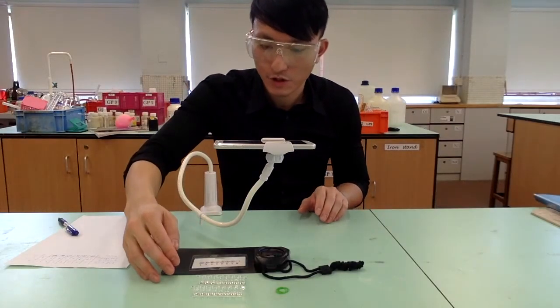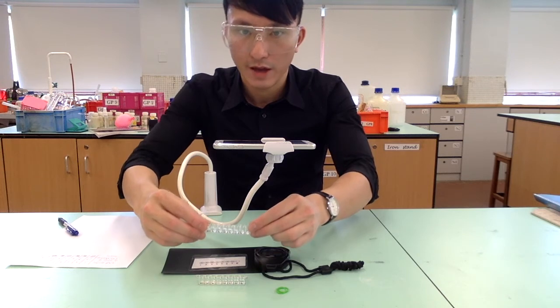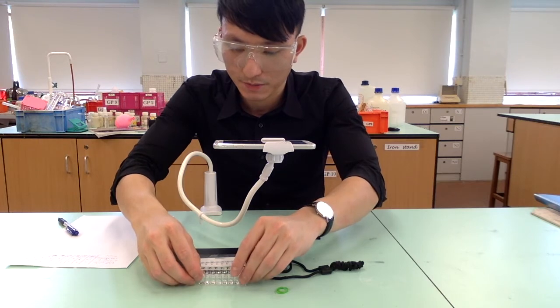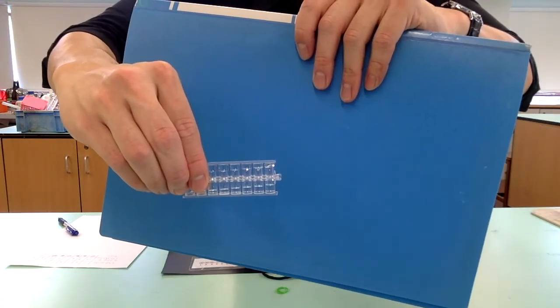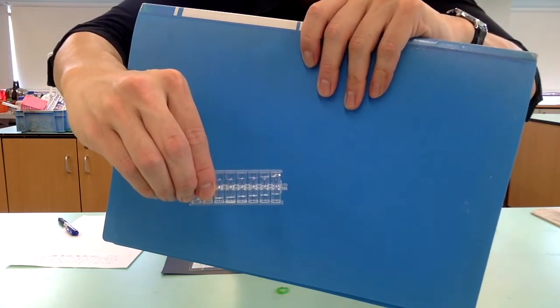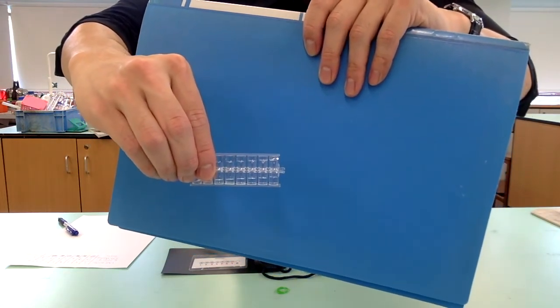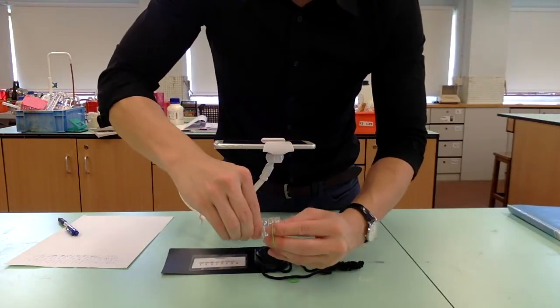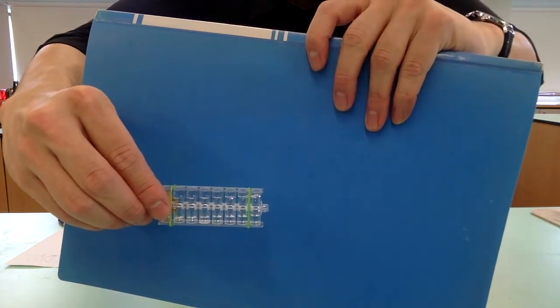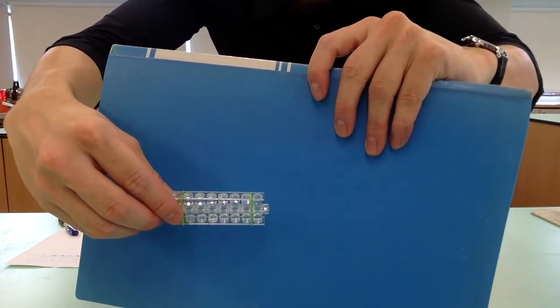After transferring the solution into the wells, we flip one of the egg well reaction strips and place it on top of the other. Notice that even though we have inverted one of the reaction strips, the liquids are not mixed. At this moment, secure the 2 strips using a rubber band. Make sure the rubber band does not affect your observation from the top.